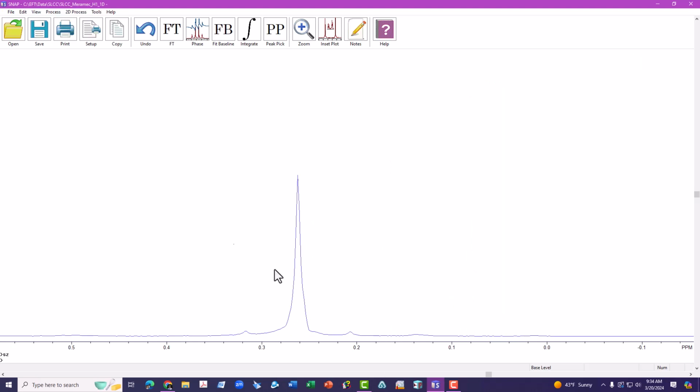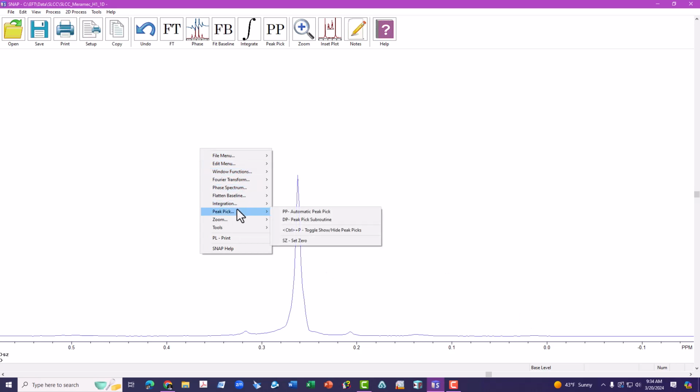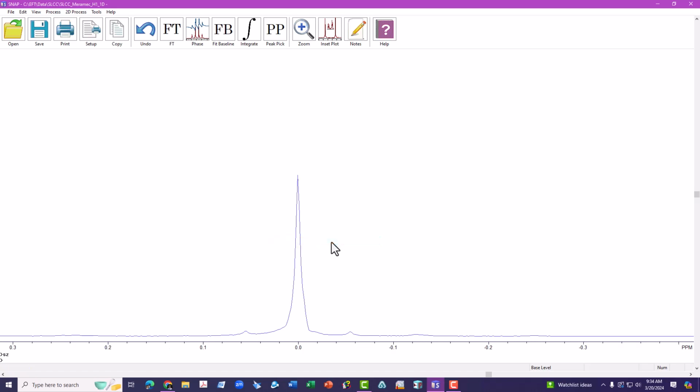And you can use the two-letter command SZ, or from the pull-down menu, SZ set 0. And what that does is that moves the axis over so that the tallest peak currently on the screen reads 0 ppm. Matter of fact, if we do a PP, peak pick, you'll notice that the chemical shift at the top of the screen is 0.000 ppm. Let's zoom back out again.